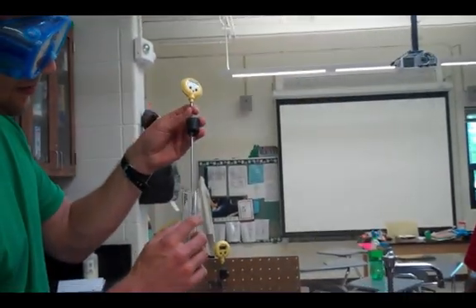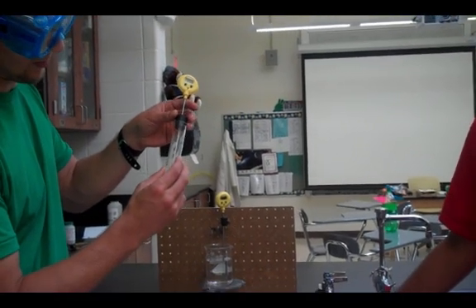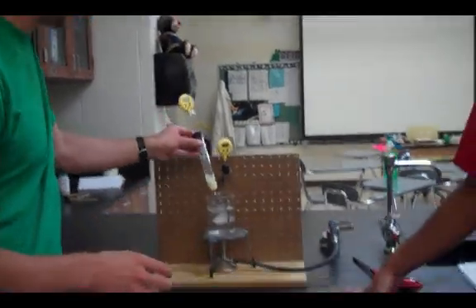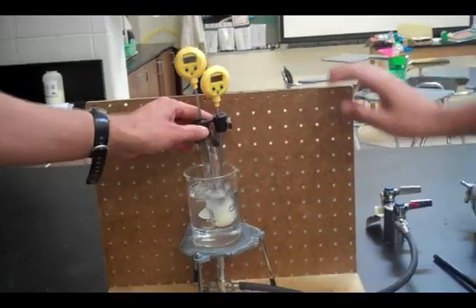So I want the tip of the thermometer to be actually in the substance, because that's what it's measuring the temperature of. And I'm going to put that in my large clamp here and make sure all of my substance is below the water level.